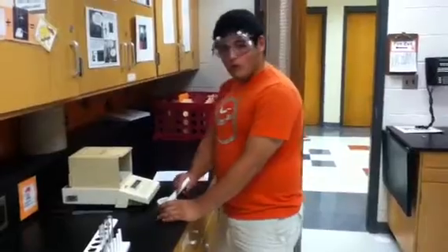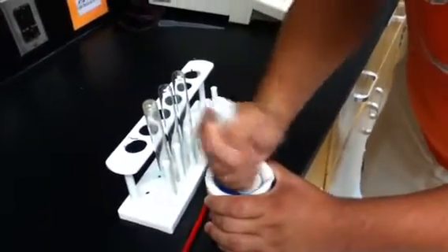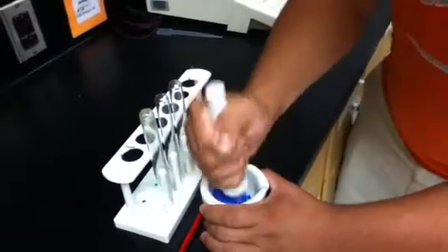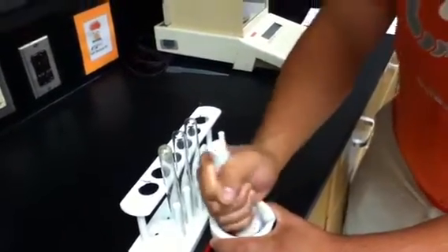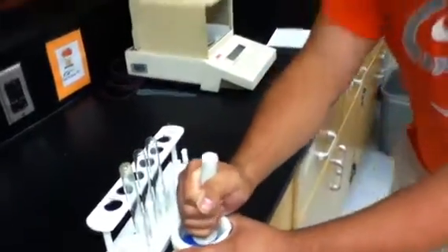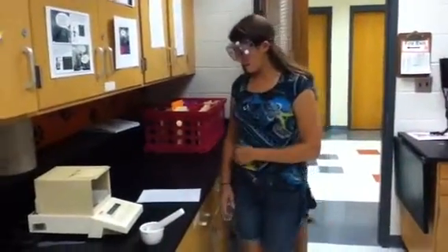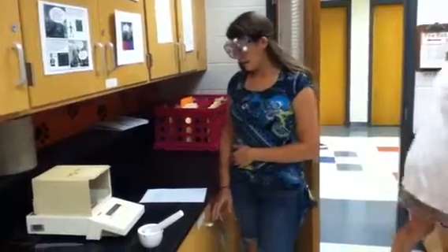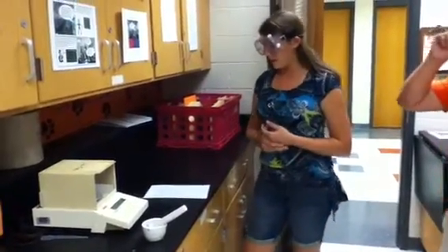Here is how you grind rock salt with a pestle. Apart from its use by chemists, the mortar and pestle are also used by pharmacists to pound up drugs.